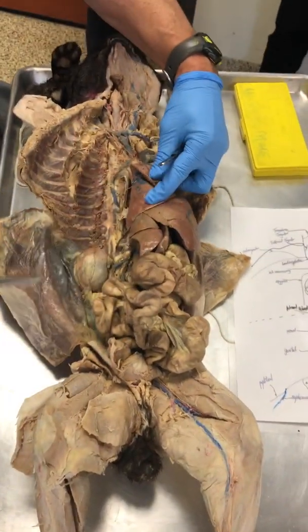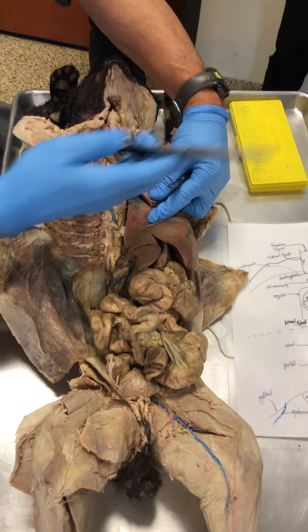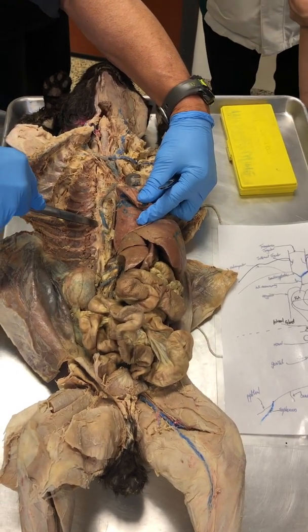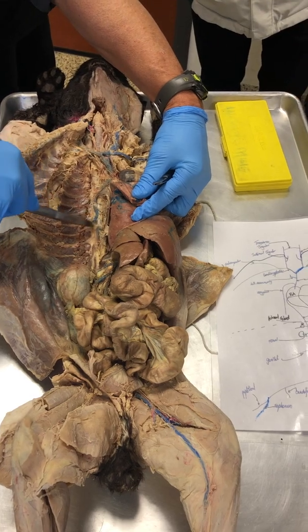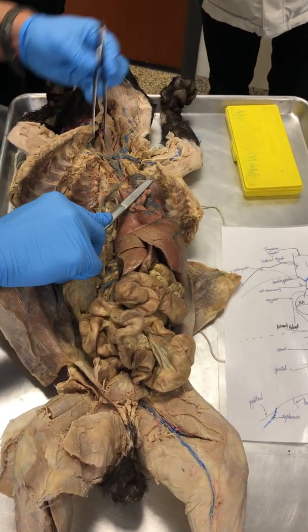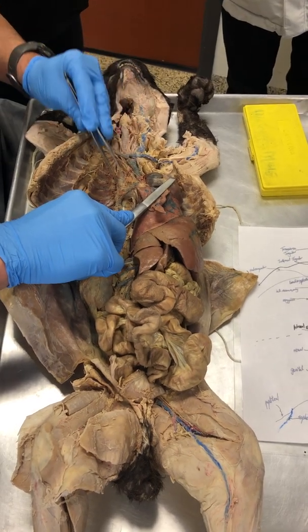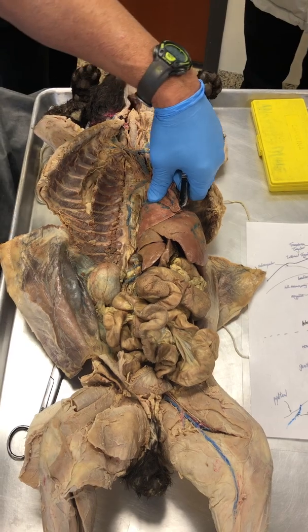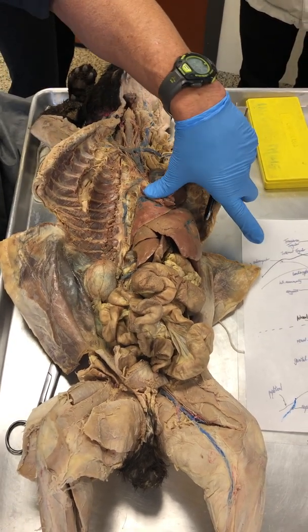Right there. Come close, you can see, folks. There is my vertebral column. On the right-hand side of the vertebral column is this vein right here that runs into the superior vena cava. And what is that vein called? That vein is called the azygous vein. Get the spelling, please. Azygous.